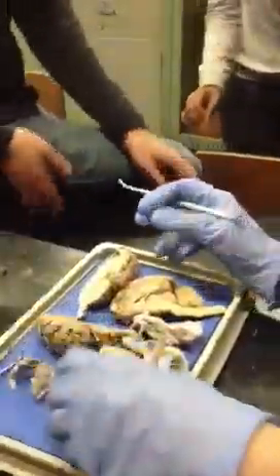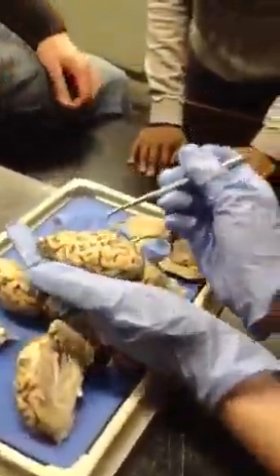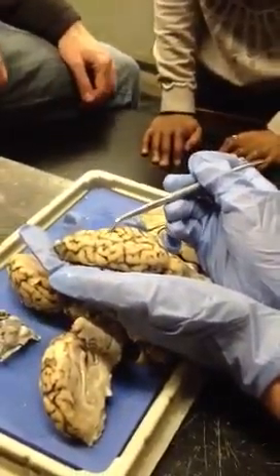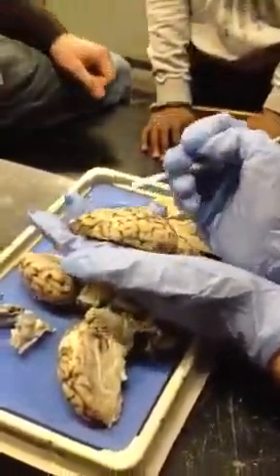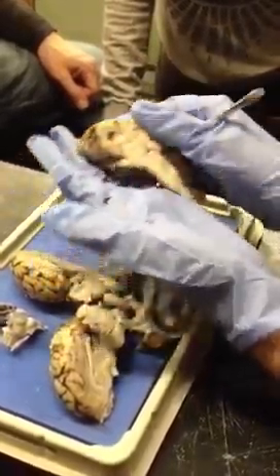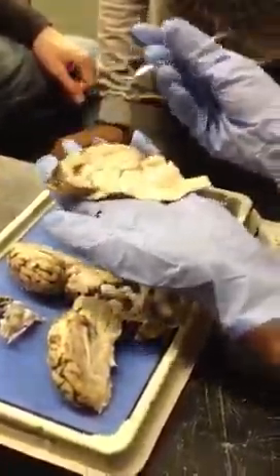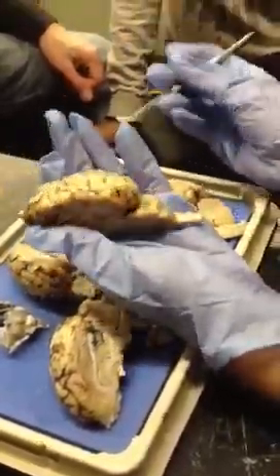We're going to have to use a bunch of different pieces in order to get you to see everything, because these are all in bad shape now. But all the raised parts are called what? Gyri, more than one gyrus. And then the indentations? Sulcus. Right. A fissure, yeah. Okay, so what's this fissure? Longitudinal. Right. Okay.